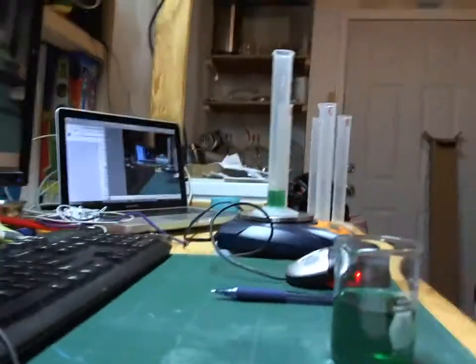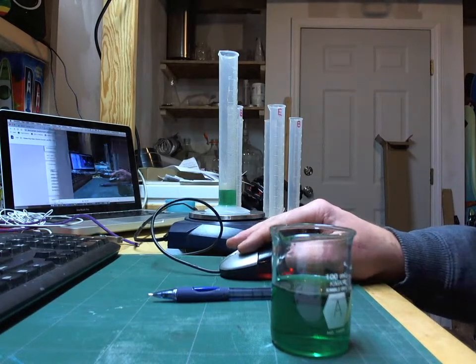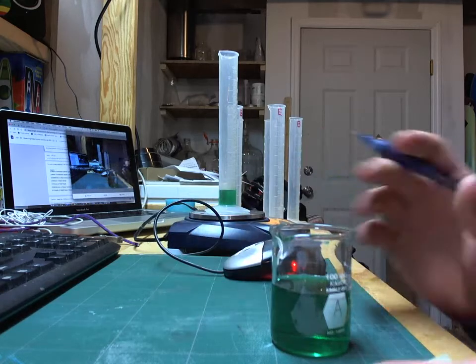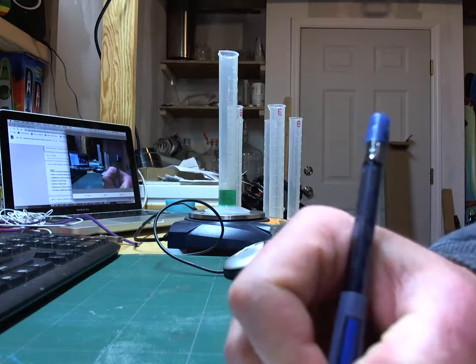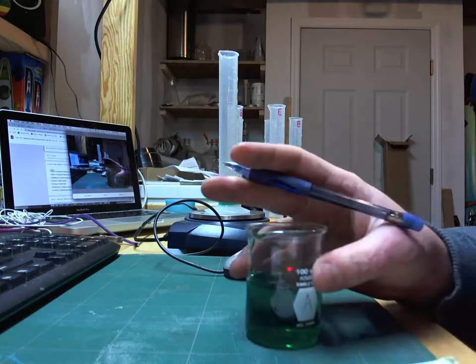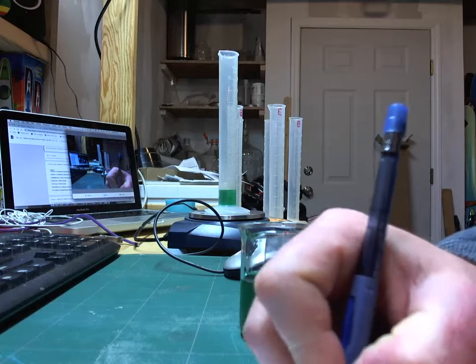So let me get some of this data recorded here. I apologize, this is my first time doing this, and I have to finesse this a bit. So number 1, mass of the graduated cylinder was 48.7 grams. And my volume initially was 11, so that's going to go for my number 2. The volume of the fluid initially is 11 milliliters.